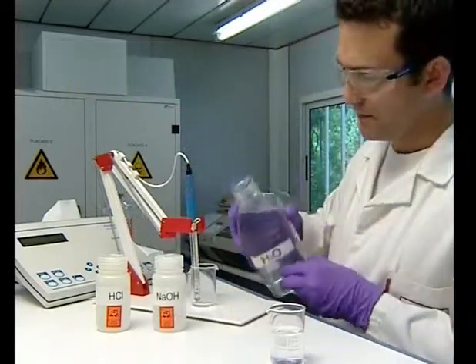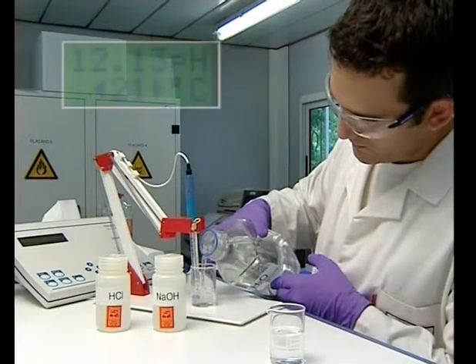In this case, we use a large quantity of water because water can only dilute the chemical product.